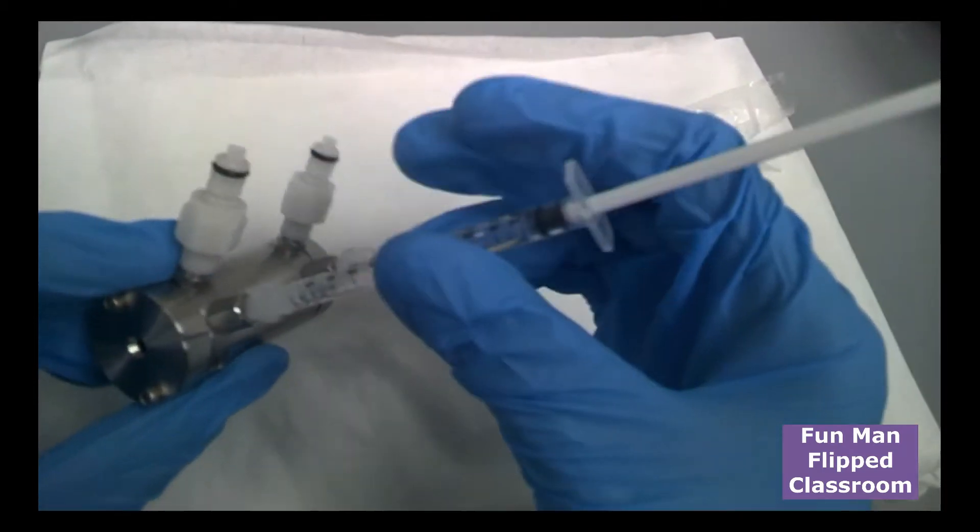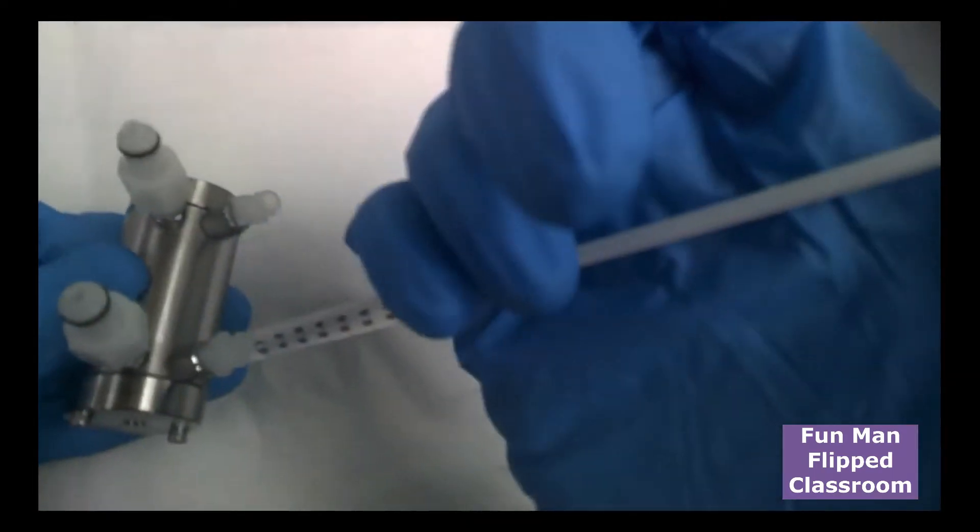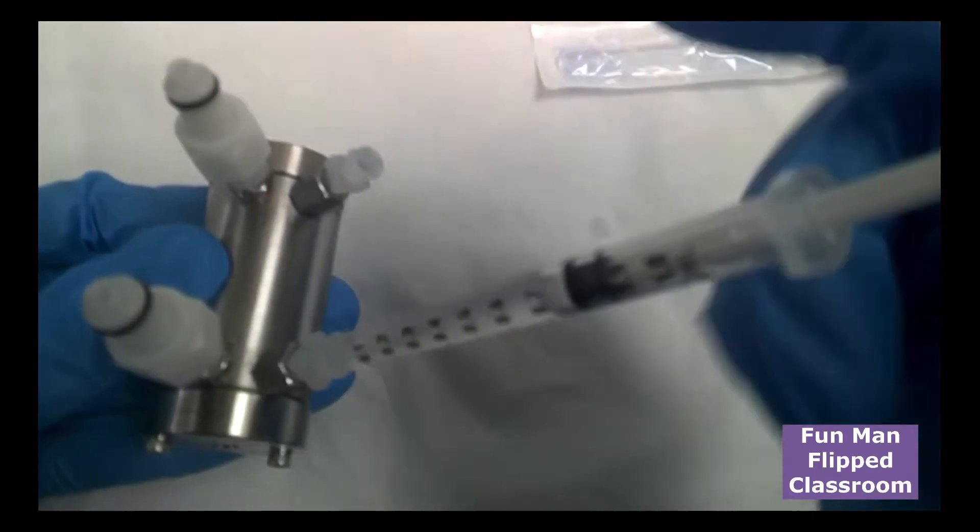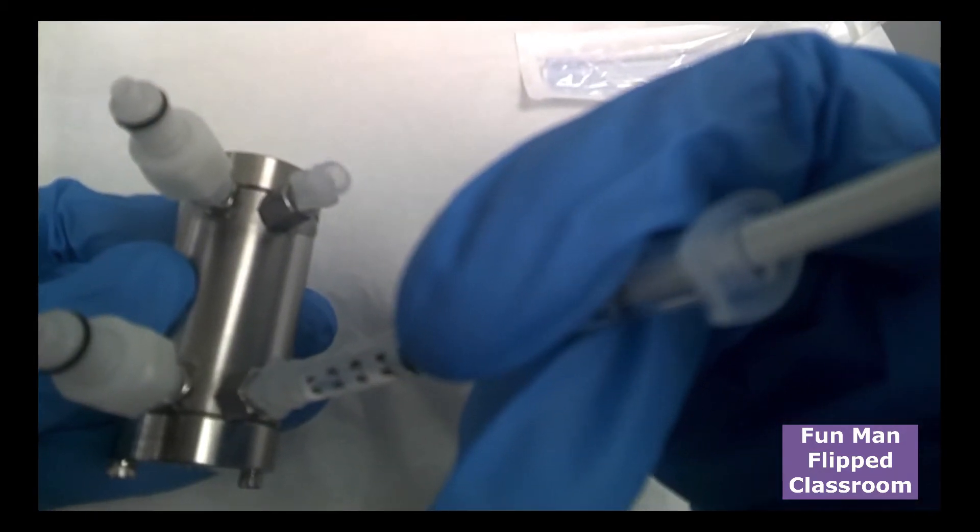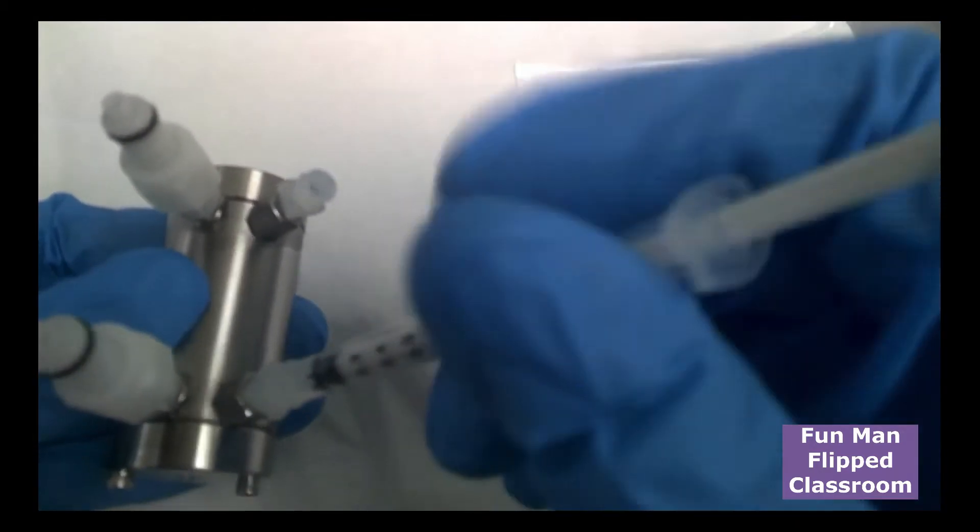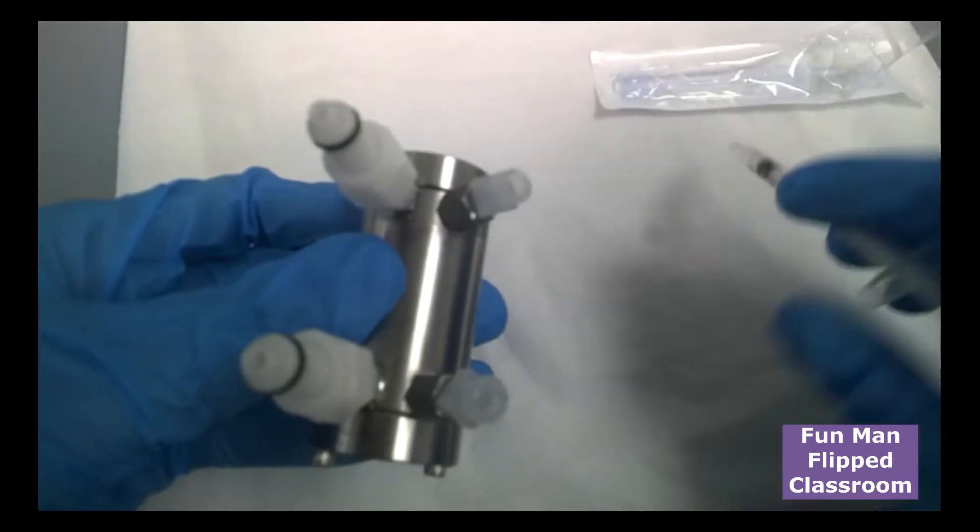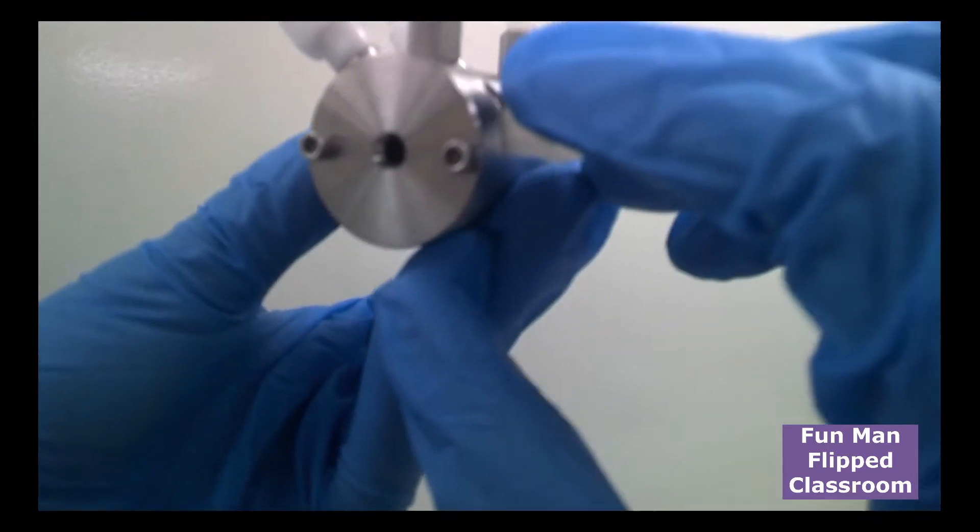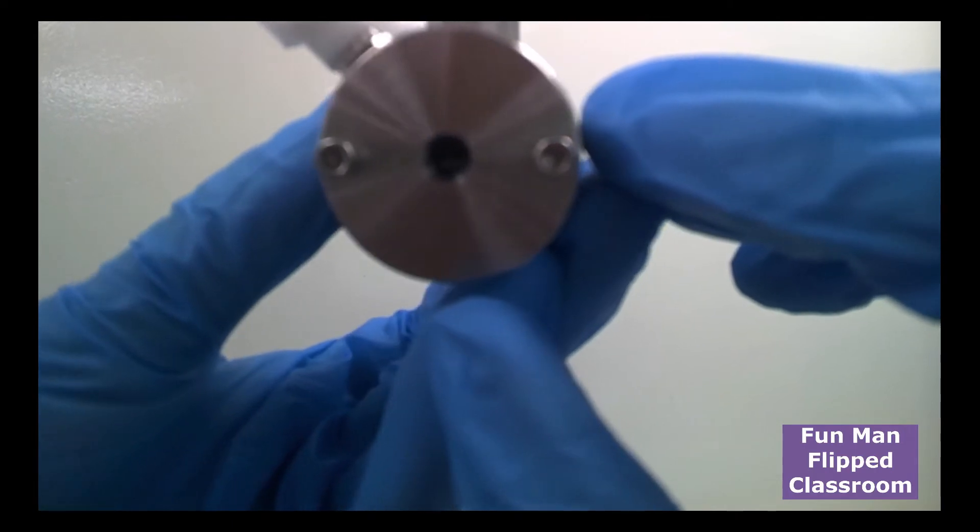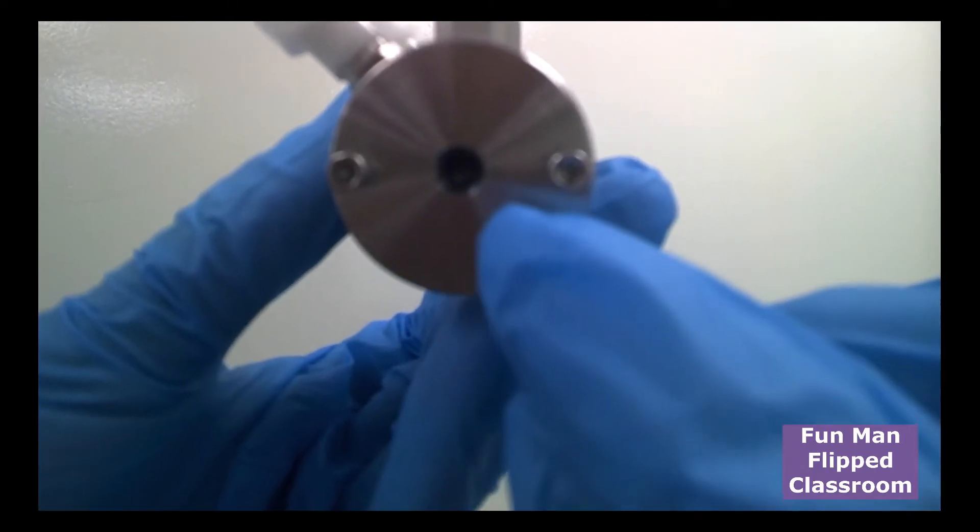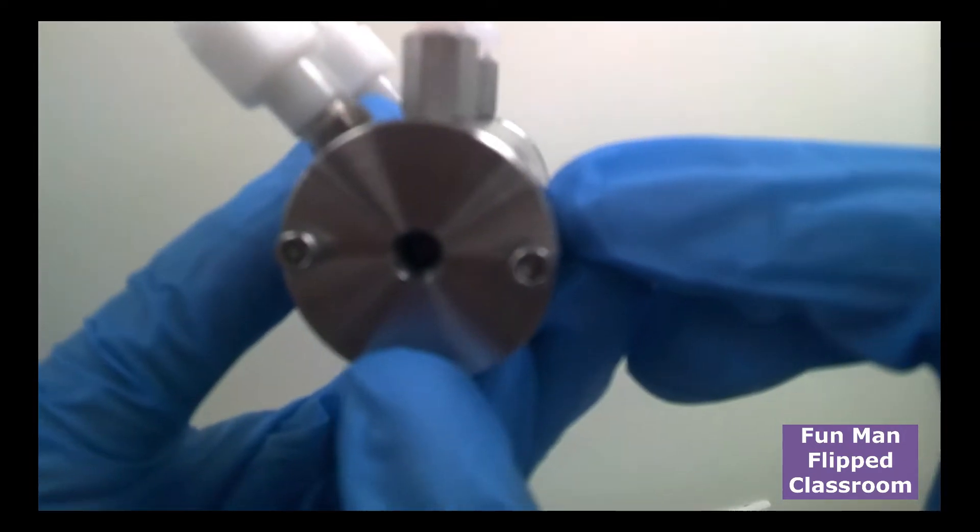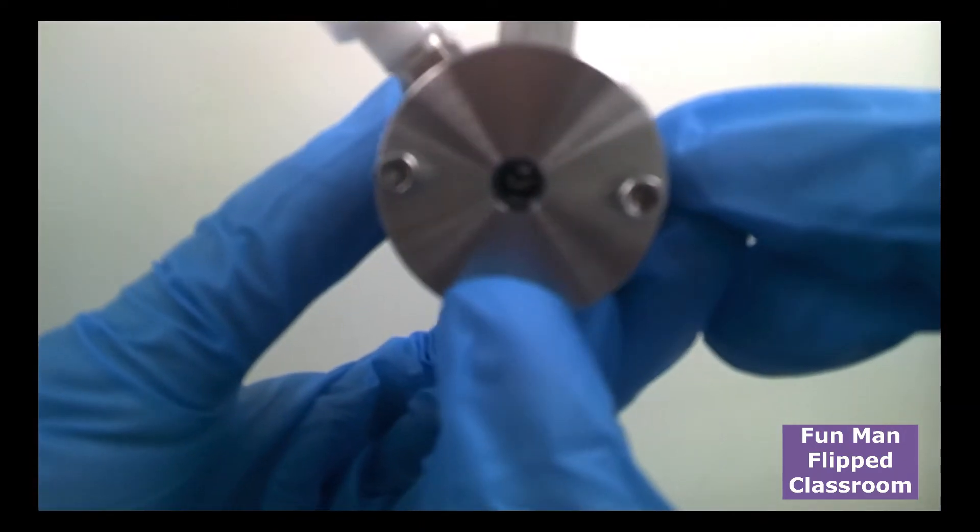Now, there are 4 holes here. You can choose the one with bigger opening so you can fit the syringe. You push from one side. I will start from here. See, now it's being secured. It's locked. You push it. This angle, you see? You see there? It came off. That means it's enough. And there's no bubbles inside. How do you check there's no bubbles? You need to look through this tiny aperture here. You see? You have to look through this hole. And then you need to rotate up and down to see that there's no air bubbles.